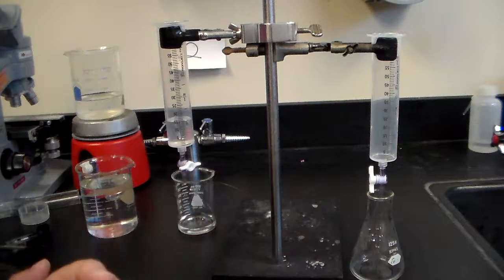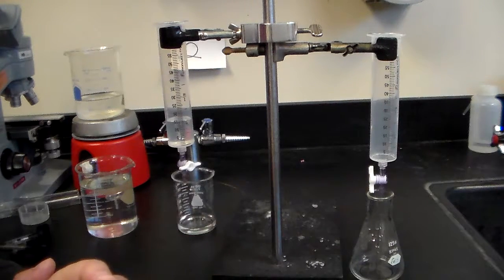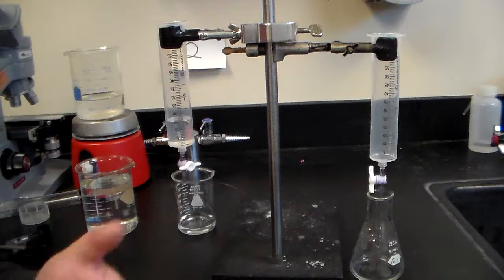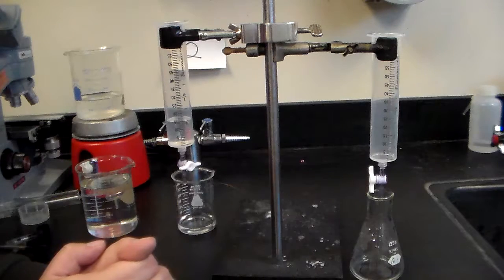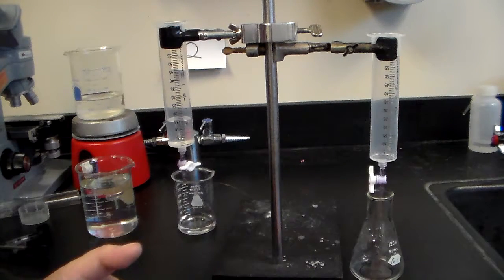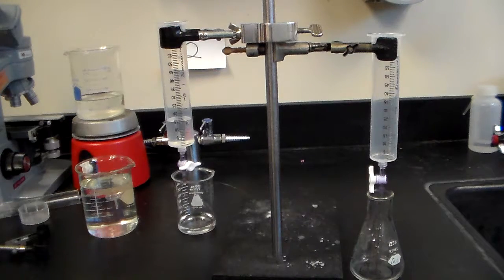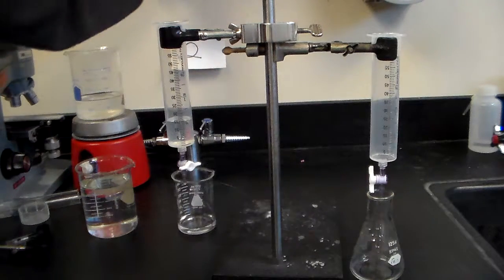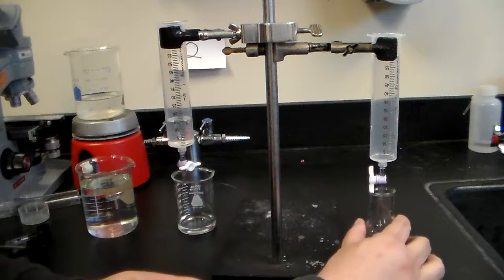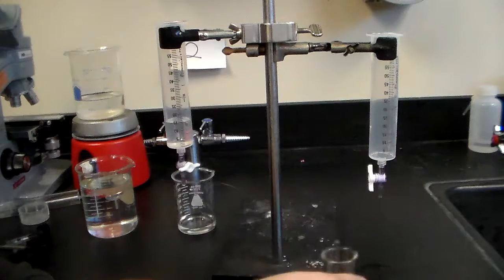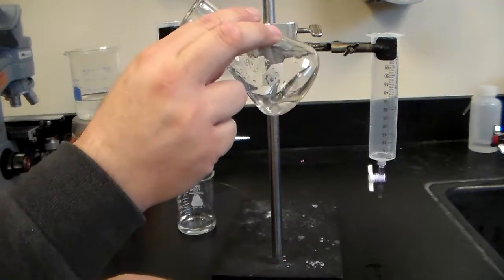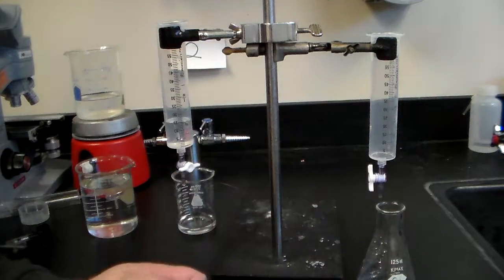To help you determine if your color of your indicator is green or not, I would suggest you put a piece of white paper underneath. I would have to go find one at the moment, but can't find it, not going to worry about it right now. But I would put a piece of white paper underneath, and then the idea is that you would swirl it until you come to that green.